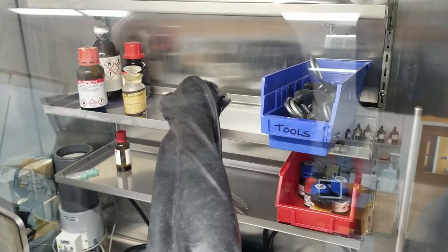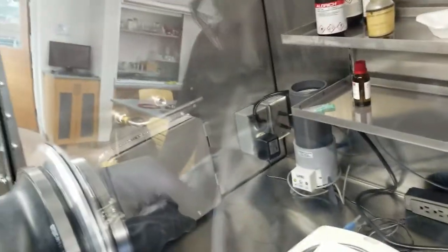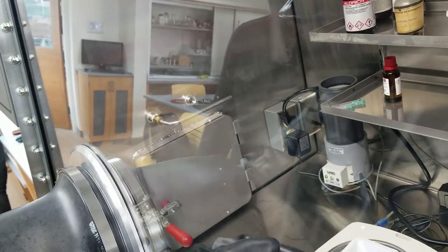And we'll just add it up here with all the other weigh boats. As you can tell, moving these gloves gets a little to get used to, and I am not used to them. Now when you're done, you just close this back up. And we're good to go.